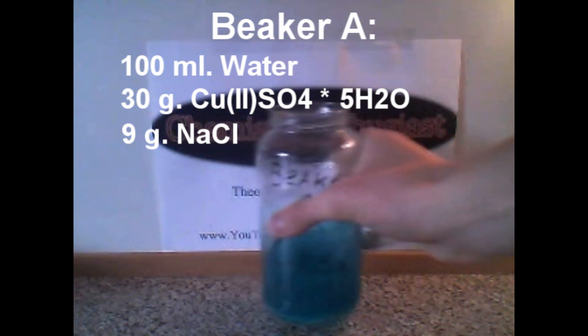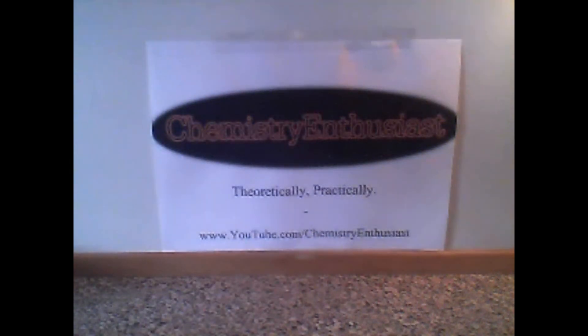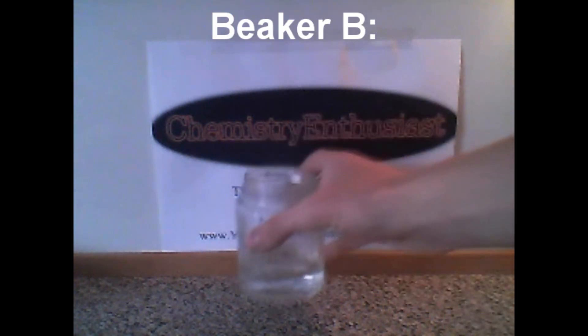Okay, I am about satisfied with the dissolved chemicals now. So let's pass on to a beaker labeled B.